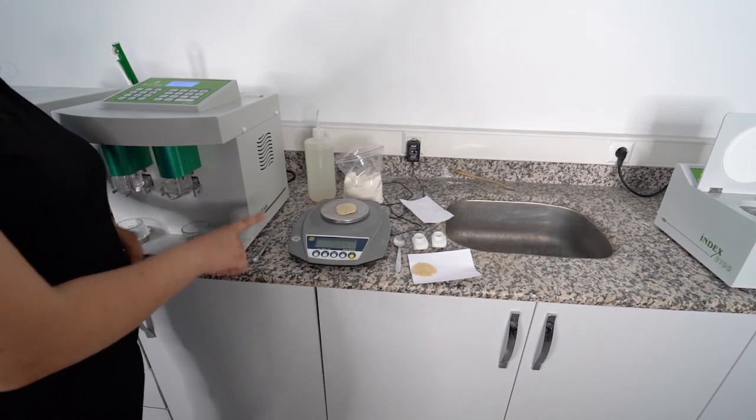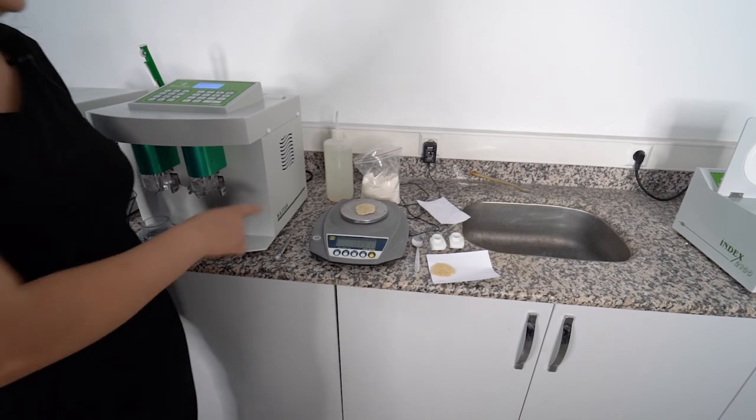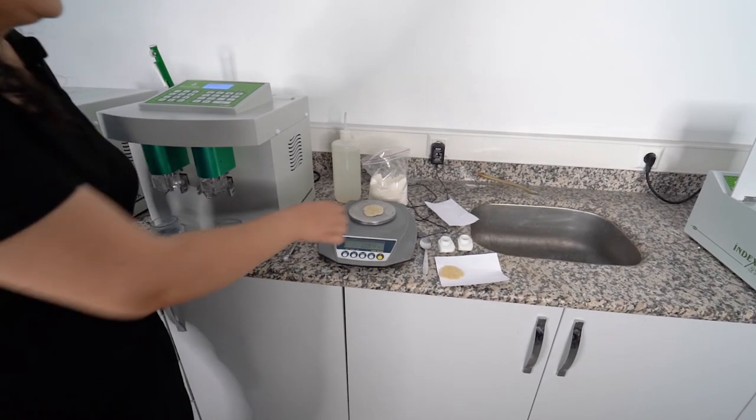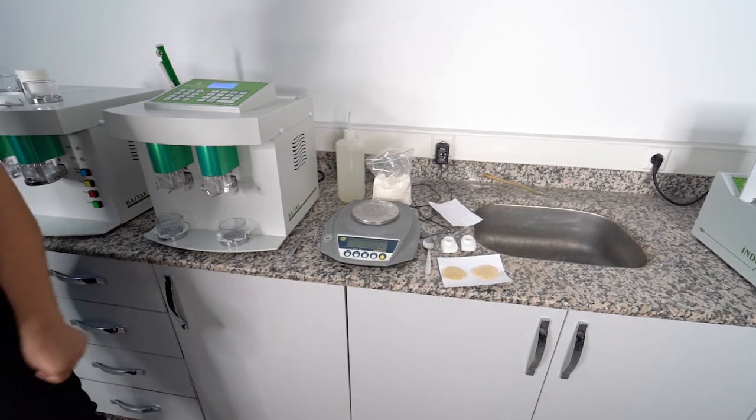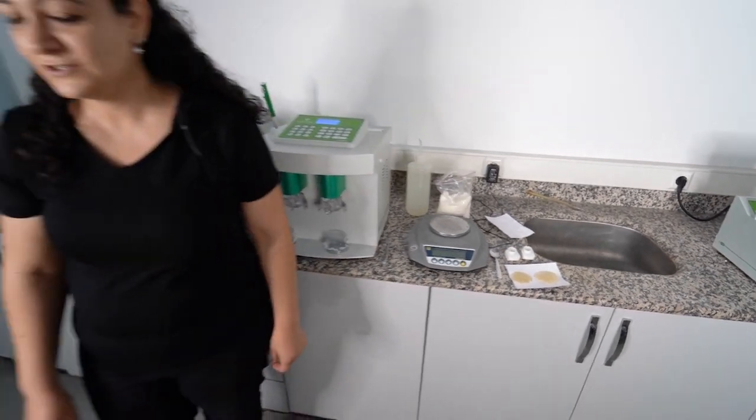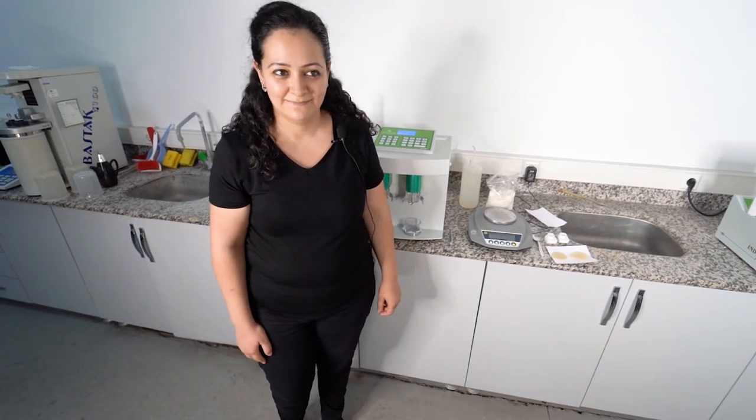We will multiply by 10 in order to learn how many grams we have. It is 9.4 for dry gluten result. Thanks for your attention and thanks for listening. See you again next week. Have a nice day.